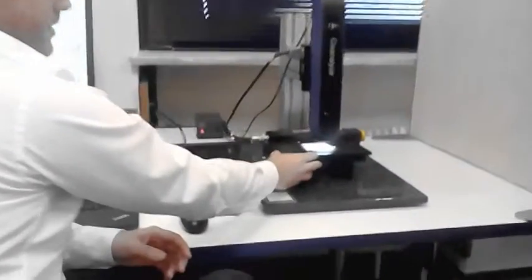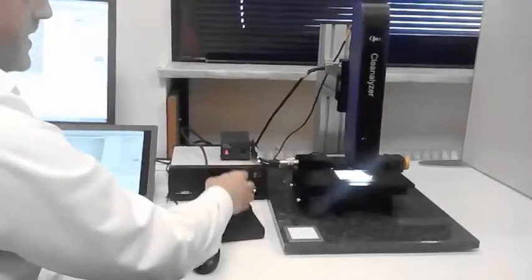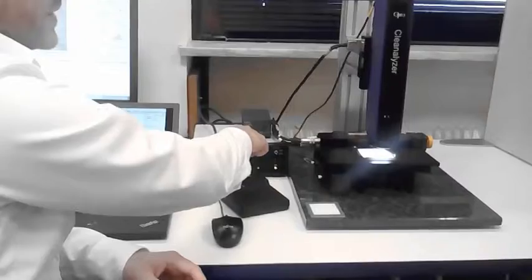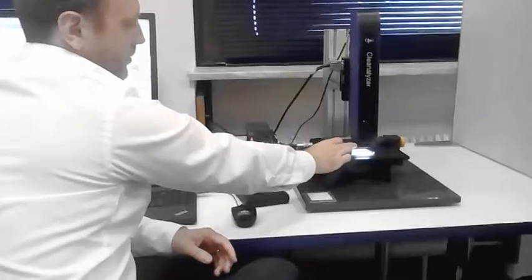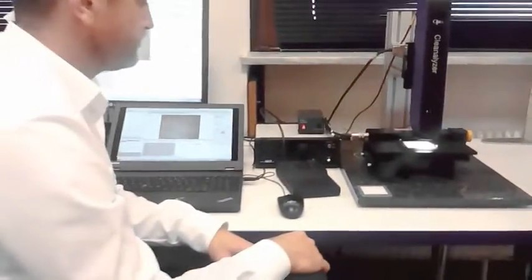We then have a motorized XY stage, and also with this 5 micron system, the motorized Z height. So we have a joystick control in X and Y, and then also a focus system integrated here through our LAN controller. Illumination is provided by a specialist ring light, which has an independent control of brightness. And then we also here have a polarizer feature, and this is a critical function in determining the difference between a metallic and a non-metallic particle, as we'll show you in the software.